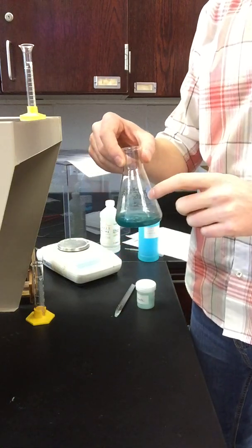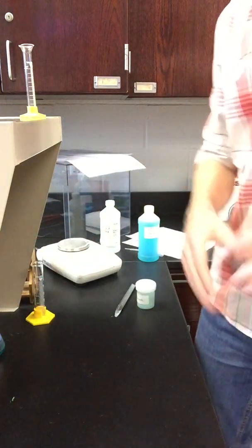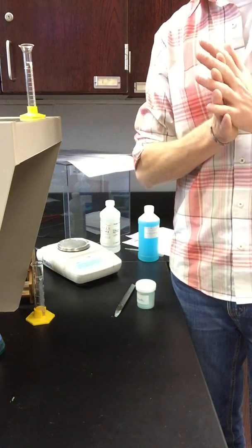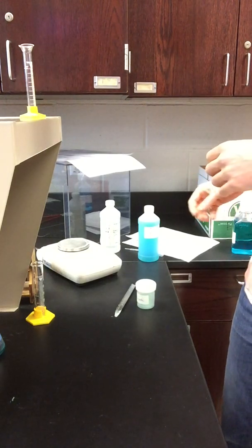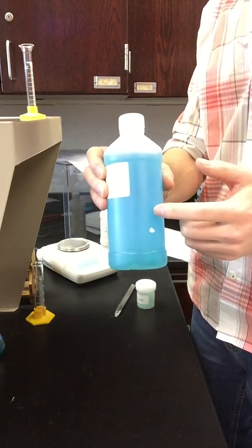So I actually want to continue to let this sit and let it continue to give off gas, and we'll revisit this in a moment. In the meantime, look down to the data table for part 2. In the interest of time, I've already completed quite a bit in part 2. What part 2 shows you is that it wants you to put together a certain volume of copper 2 sulfate stock solution. That's this container that has blue stuff in it.